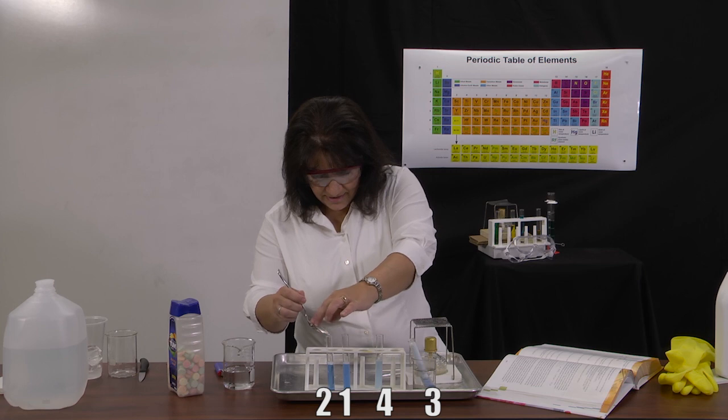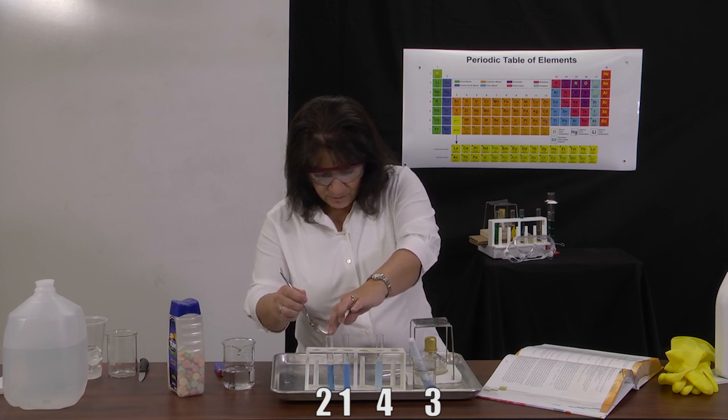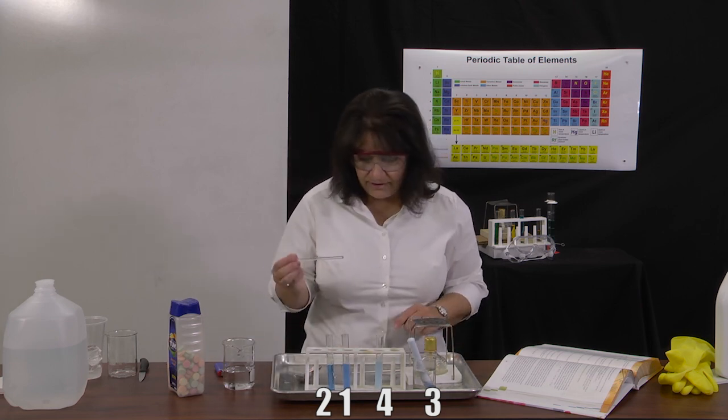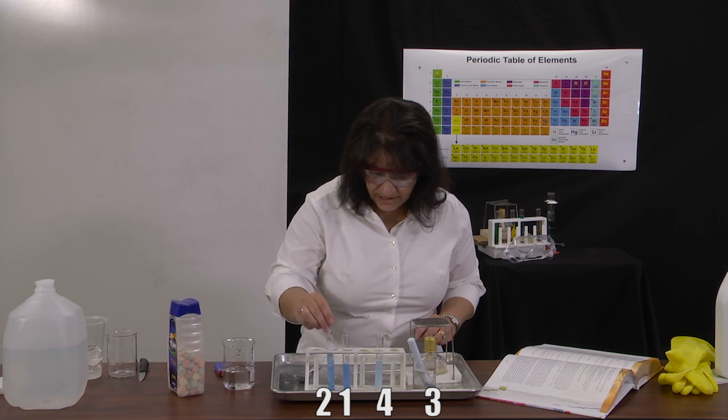Very carefully add that in. And in a second, I will move them around so you'll know which ones we're doing here. And I'm going to use a different stirring rod to get that mixed in.